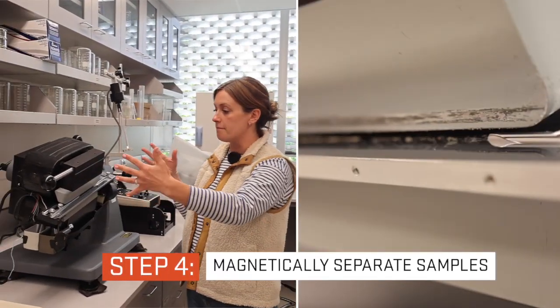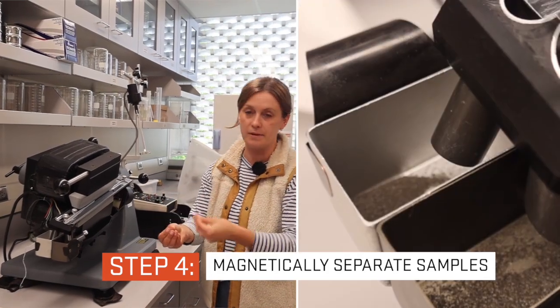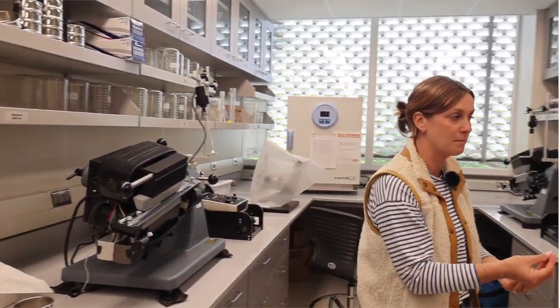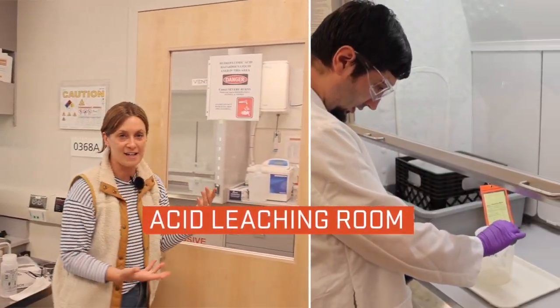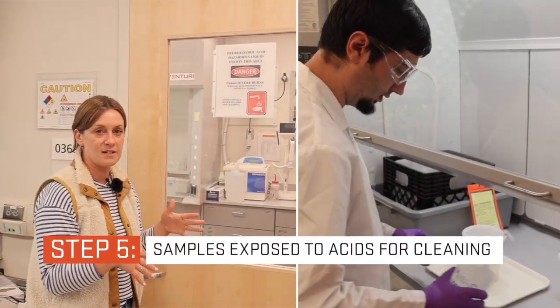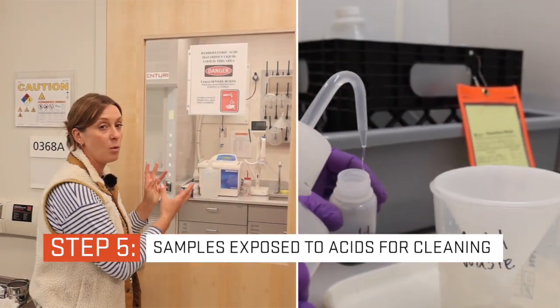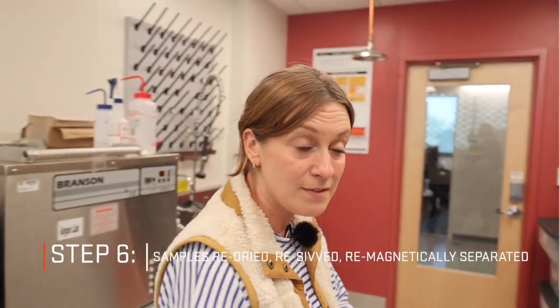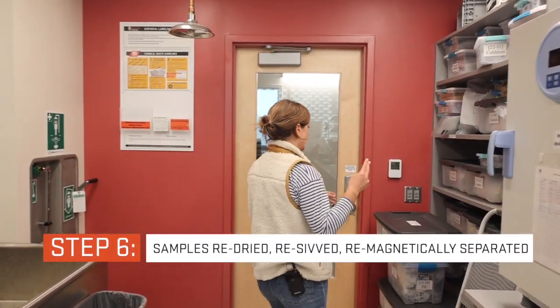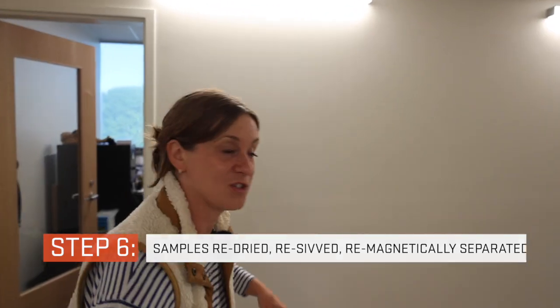This is just a really fancy magnet with a ramp, and it separates our sample into a magnetic component and a non-magnetic component. Once we have those components, we move over here into the acid leaching room, and here we have a variety of acids that we expose the samples to just to clean them up. Once the samples are removed from the acids, we dry them, we end up re-sieving them, and magnetically separating them again, just to get it as pure as possible into what we're interested in.